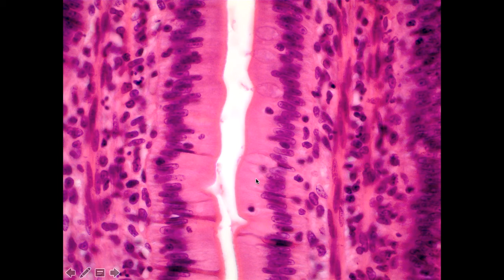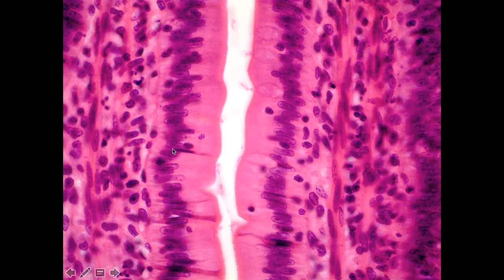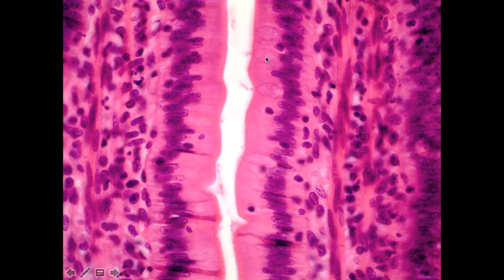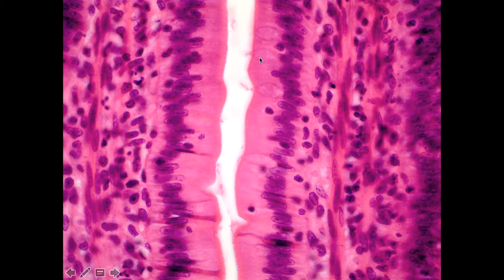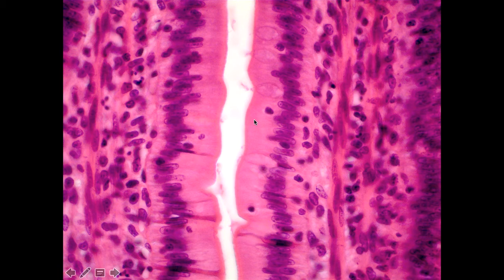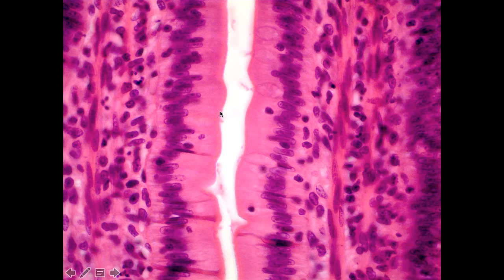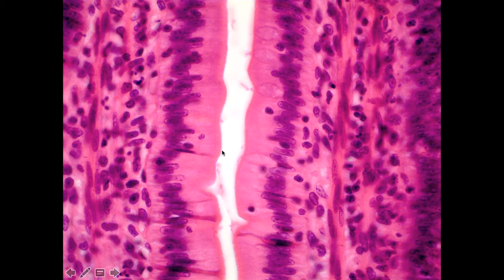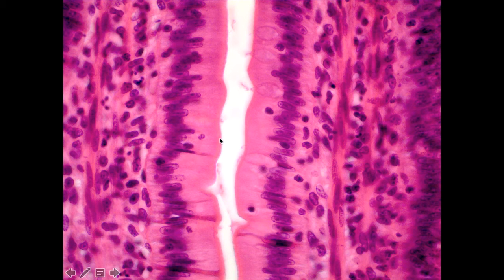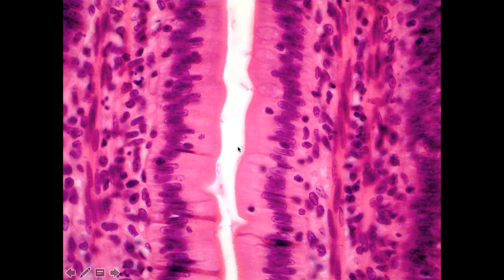Here is a very nice close-up view of the epithelial layer. The thing to note is we have simple columnar epithelium, but in addition to that we have goblet cells. For the first time you'll notice very distinct urn-shaped or goblet-shaped cells — those mucus-producing cells. We can also see the brush border: these cells have microvilli. We can't see them individually, but collectively we see this fuzzy border. So the small intestine has simple columnar with goblet cells and microvilli represented by this thin, hazy brush border.